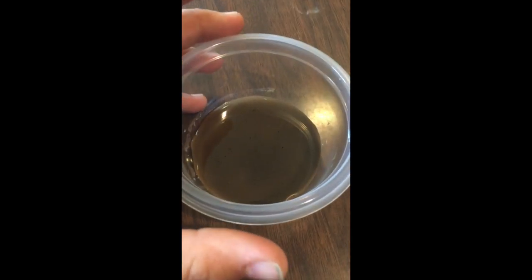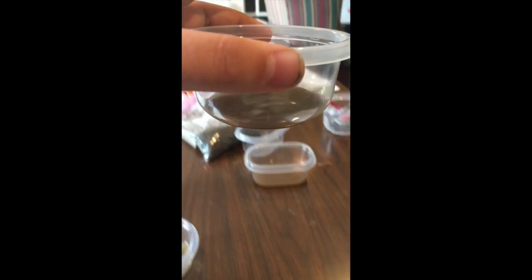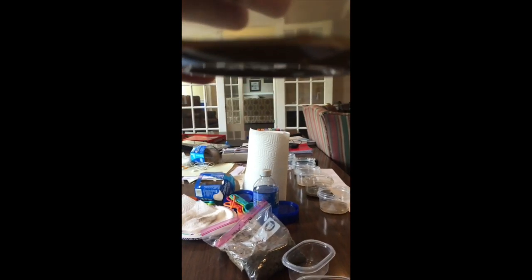And here is the forest. Still some stuff on the top, but I've drained about all the water I can without losing some of the sediment. You can definitely tell right there. I don't know if it'll focus, but you can, yeah, right there. You can tell the difference in the layers. And you can see how much sediment's really at the bottom of there.